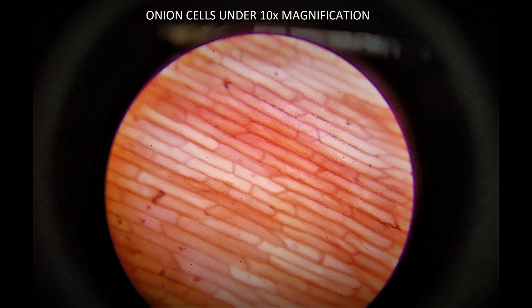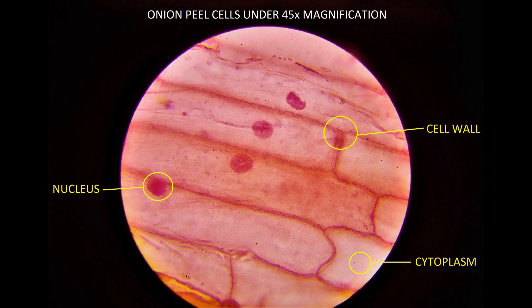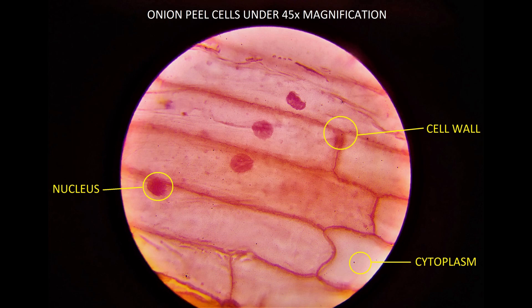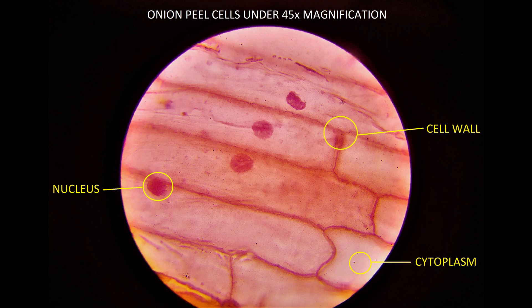And here, under the 45x objective lens, the cells, nucleus, cytoplasm, and cell wall — everything is clear. Here you can easily understand how the round nucleus is represented, how the cell wall is represented, and how the dense cytoplasm is represented within the cell.